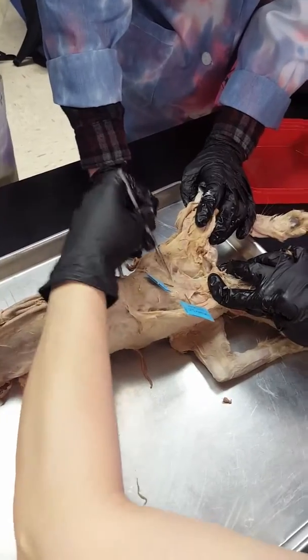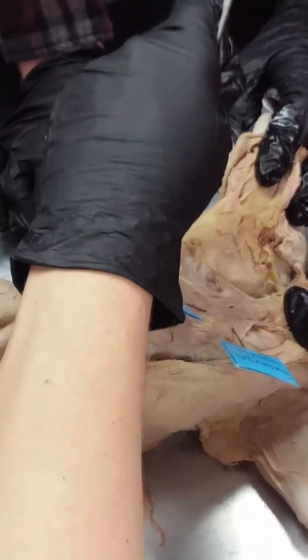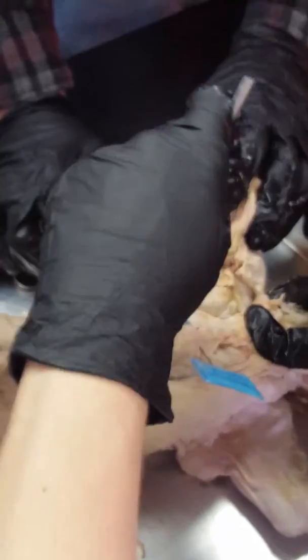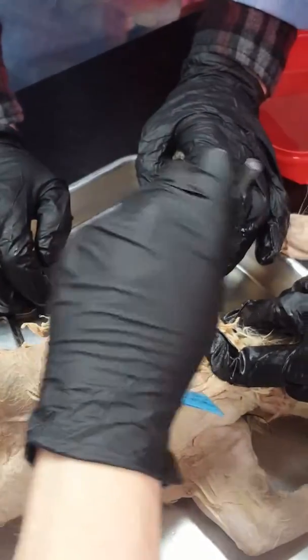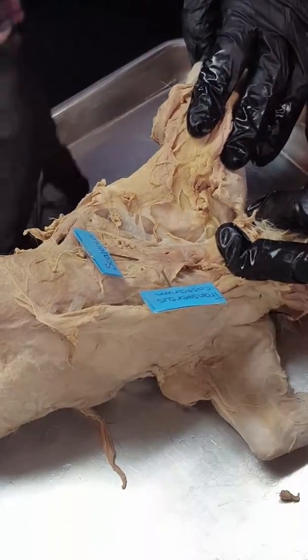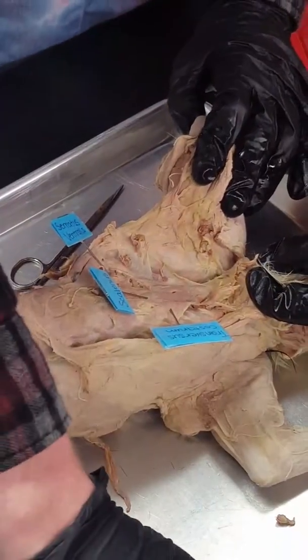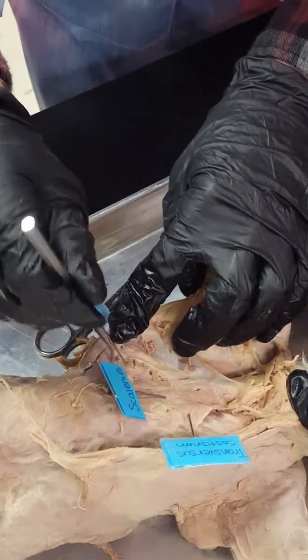Now we're going to clean this up and it looks so pretty. We call this the fan — this is your serratus ventralis. If you get between each of the pieces of meat it'll look really cool. This is what covers the ribs; in cats it's called ventralis, so serratus anterior/posterior in humans is serratus ventralis in cats. This whole section that looks like a fan is your serratus ventralis. Tag it first, then I'll make some more cuts — take photos if you want of these three side by side.